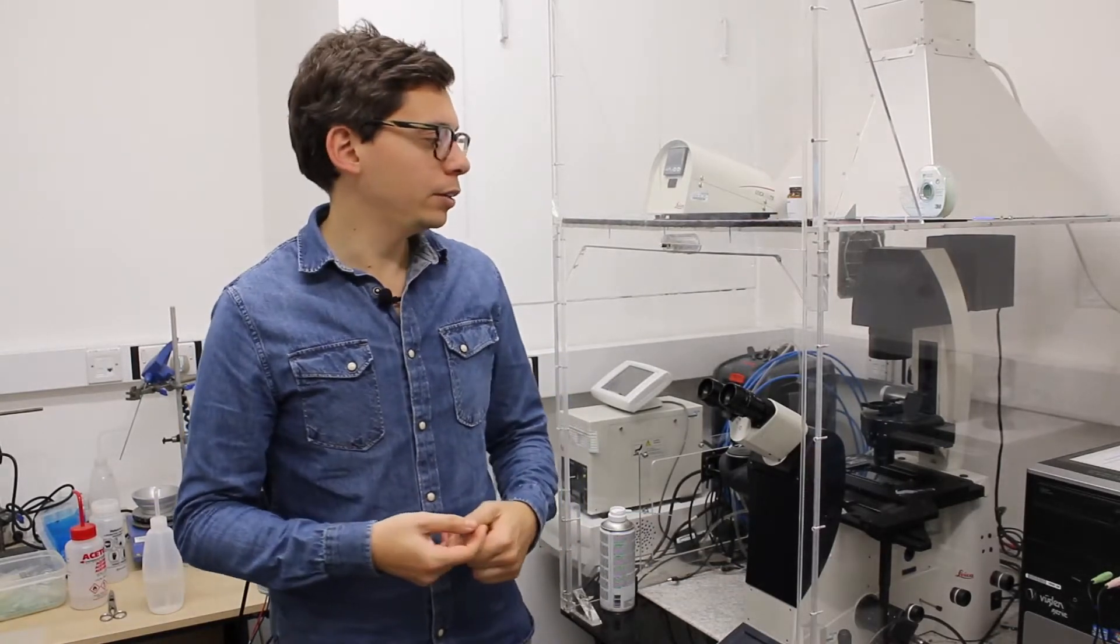So this is how you use the Leica Brightfield microscope. So now you know all about loading the samples, changing objective, and using the oil immersion lenses. Some general remarks to conclude.